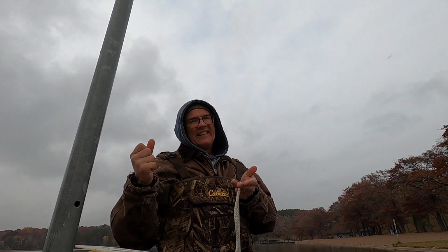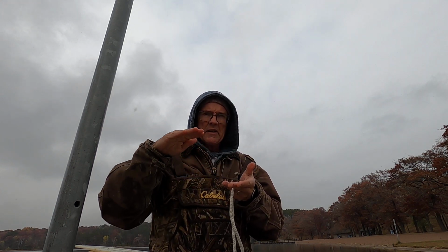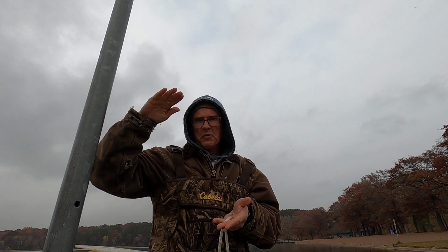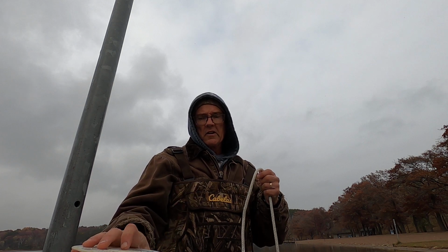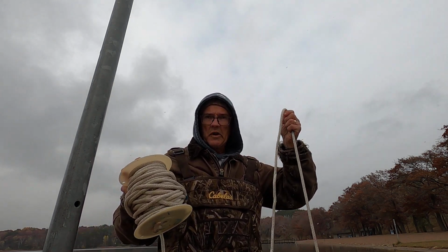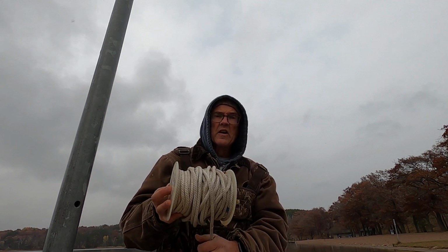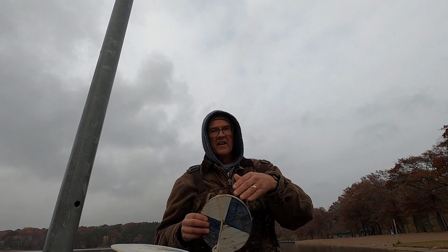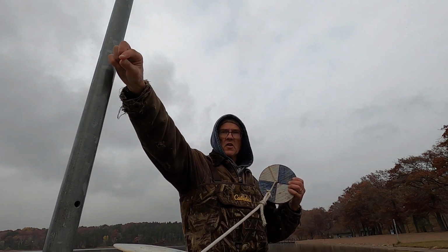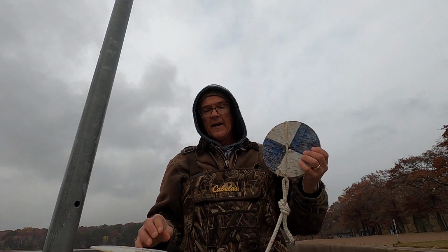So in some lakes, like Lily Lake in the summer, with all the algae and stuff in the water column, it disappears maybe at 2 feet, maybe 3 feet. Square Lake is notorious for having a super deep Secchi disc reading, like something around better than 11 feet. So this disc won't disappear from view until the piece of rope is over 11 feet in depth. That's really wonderful water clarity. So that's a Secchi disc reading.